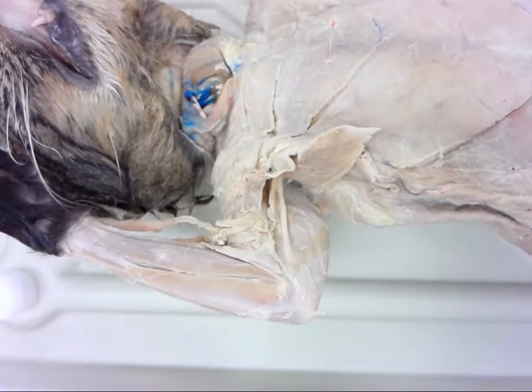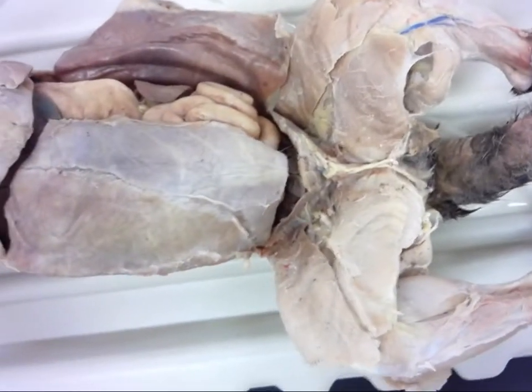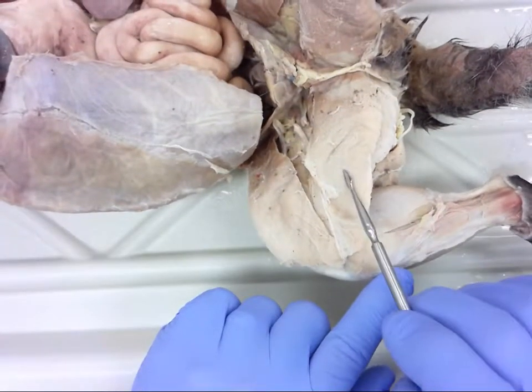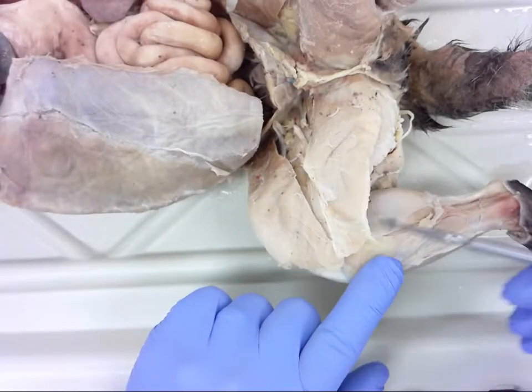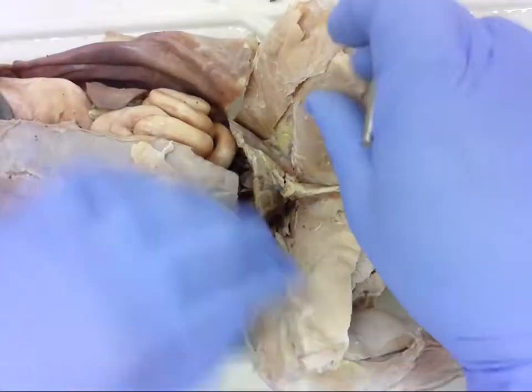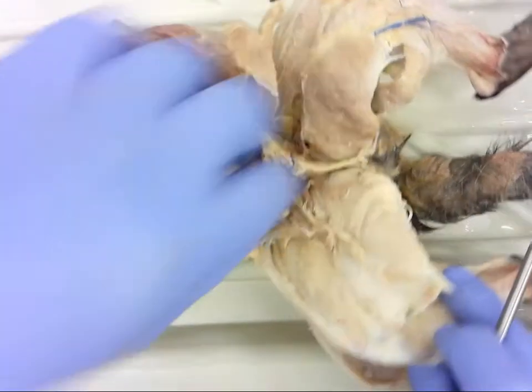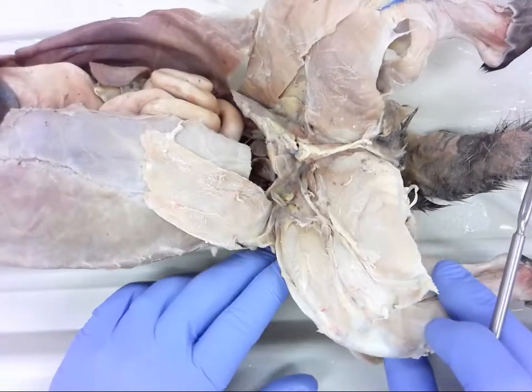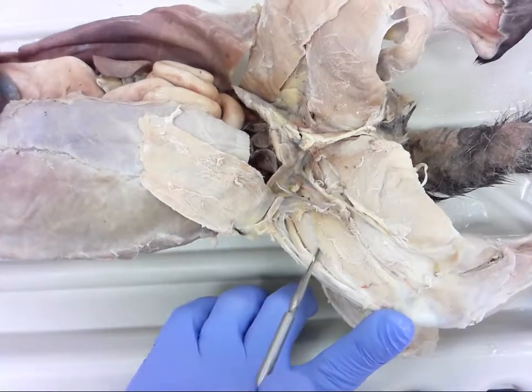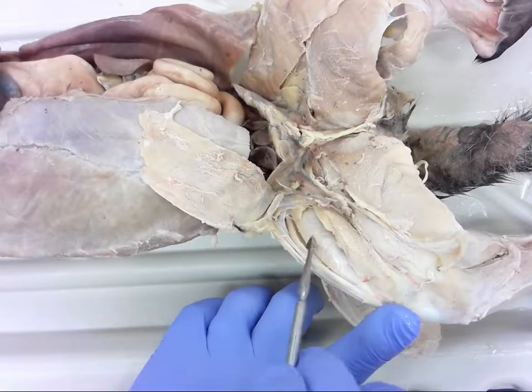For number seven, we'll move down to the lower limb and zoom out. Number seven. Move these two out of the way and go over to the other side to give a better view of this muscle group. Number eight is here — we can open that up a little bit more. This is number eight.